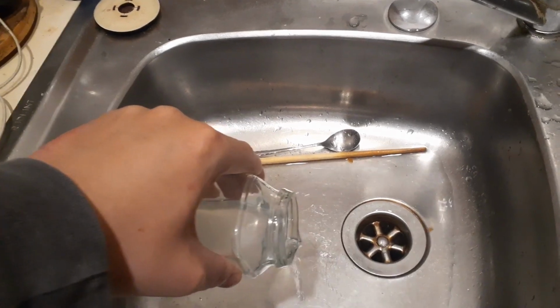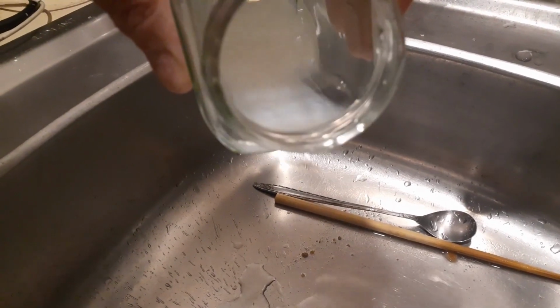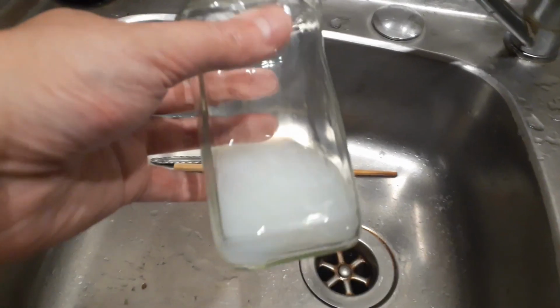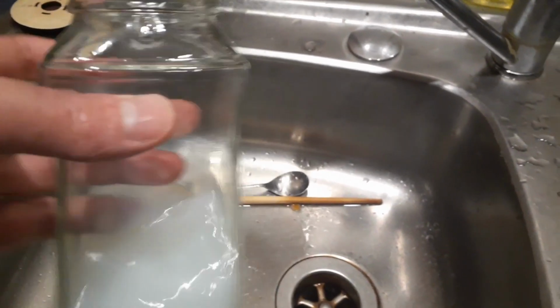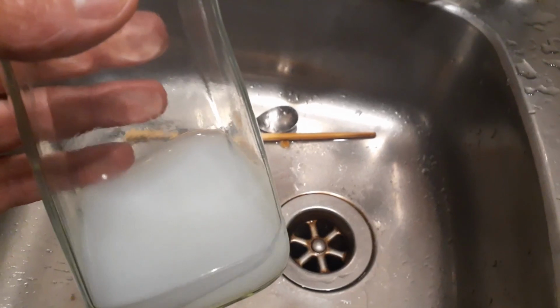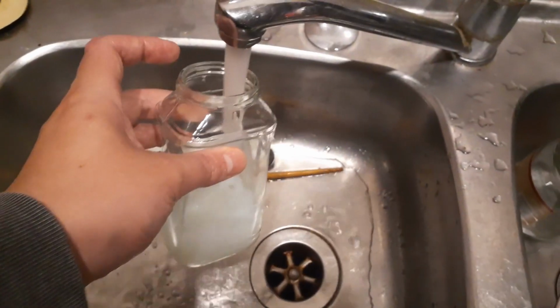When you start to see it kind of coming out like so, and you stop, you see that? With all this, what we're washing out is the alkalinity and the salt. Now if you've got a bunch of stuff down the bottom, you can shake it up and then pour it into a new jar and leave it. I mean, if you've got minerals at the bottom or metal, get more water going.